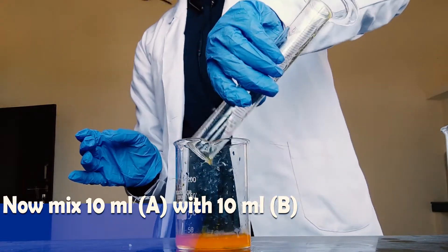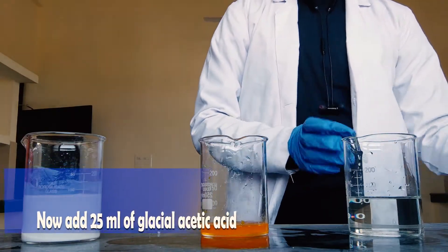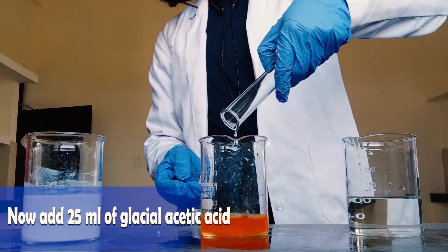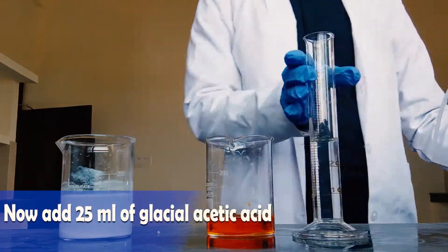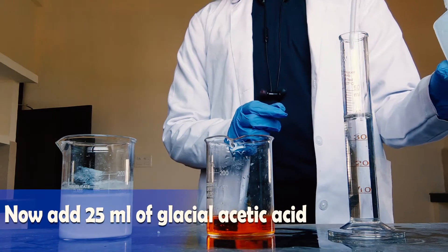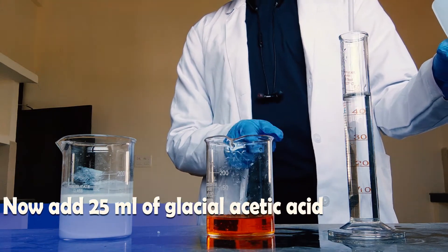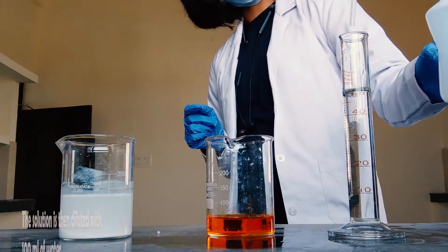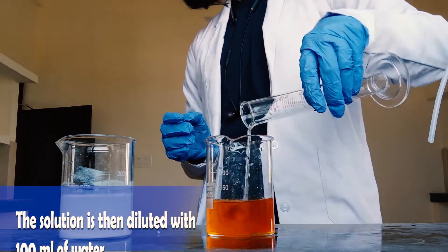Now add 25 ml of glacial acetic acid to it. The last step is to add 100 ml of water. The solution is then diluted with 100 ml of water.